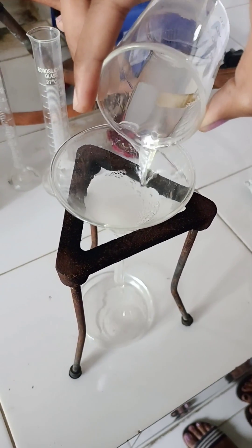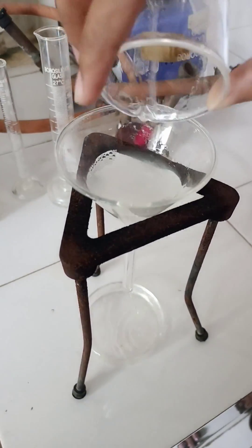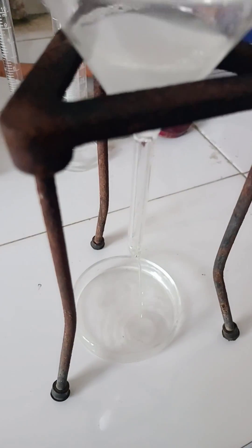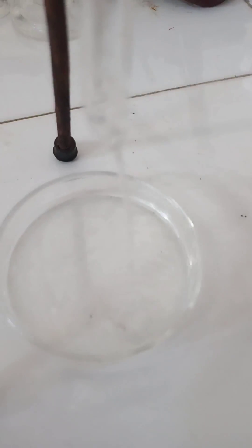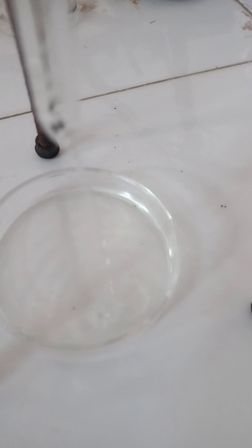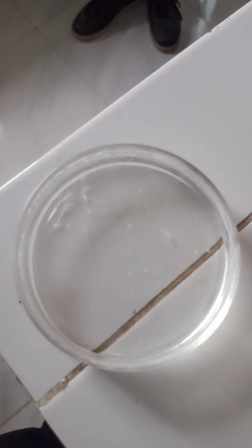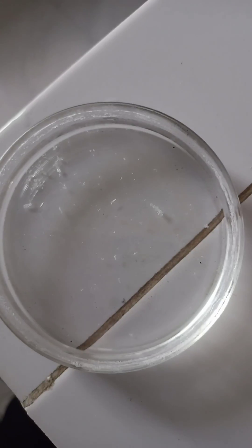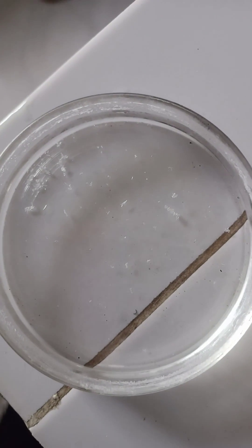Collect the filtrate in the Petri dish. Keep aside for 5 to 10 minutes and the recrystallized product will be formed.